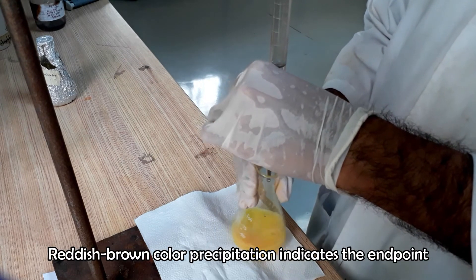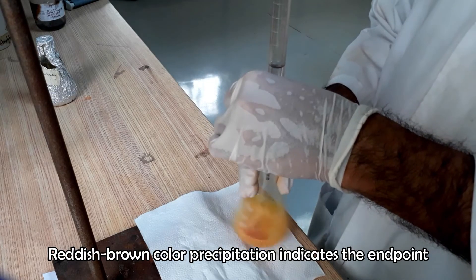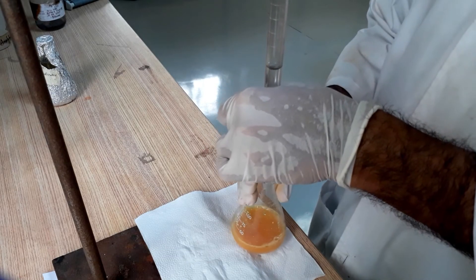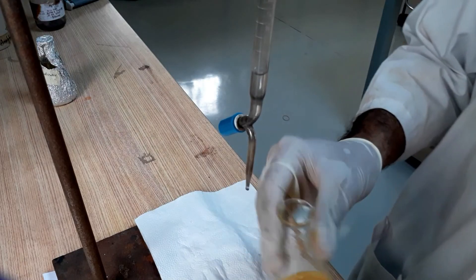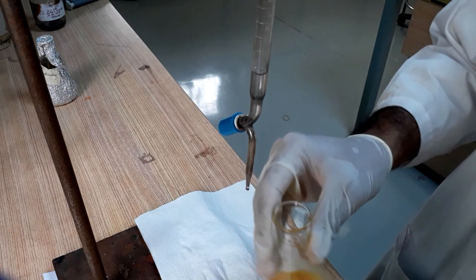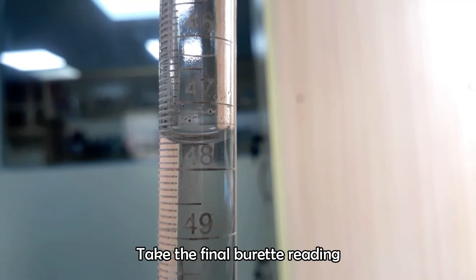Reddish-brown color precipitation indicates the endpoint of the titration. Now take the final burette reading.